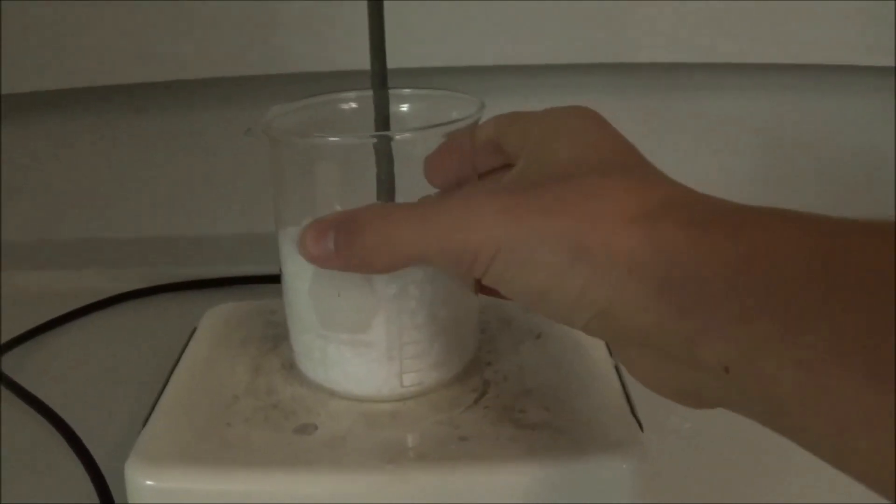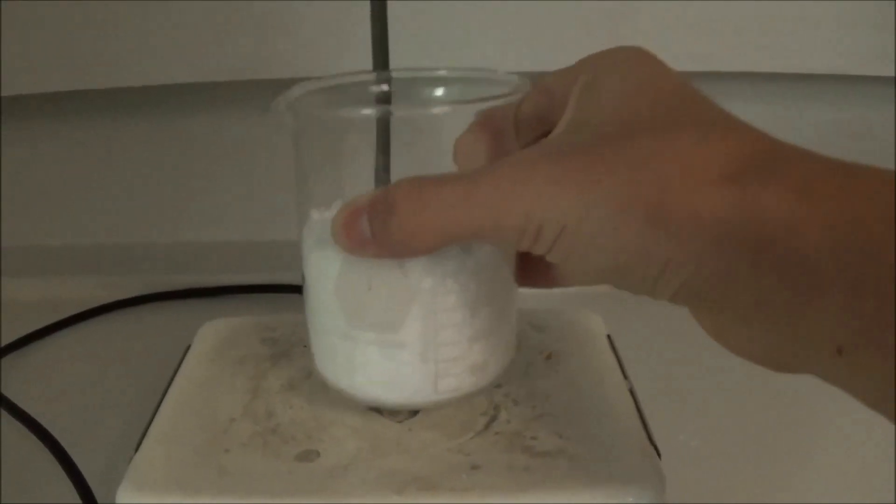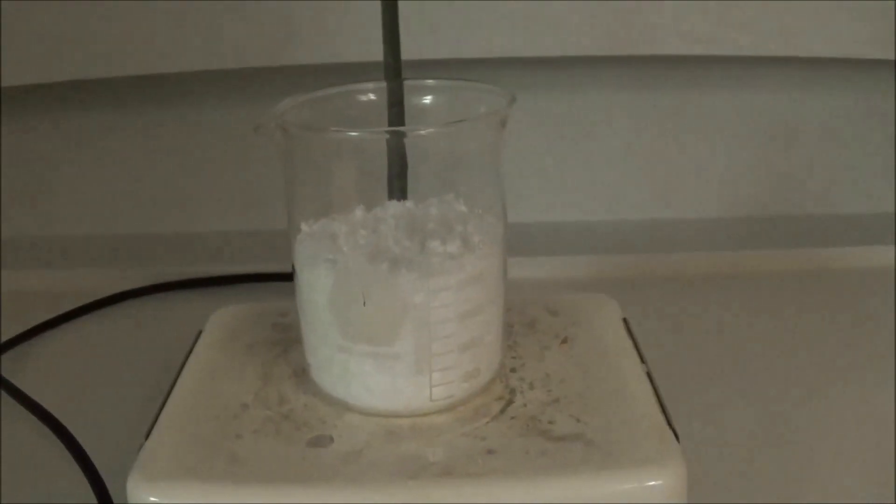Hello everyone and welcome back to the lab. In this video I'll be preparing phthalic anhydride from phthalic acid.